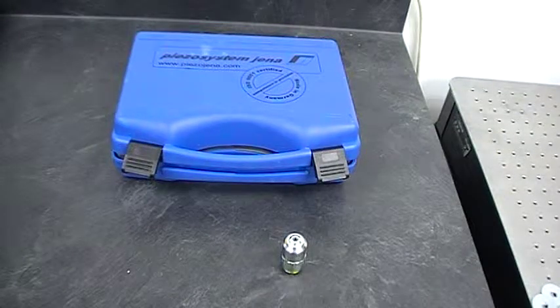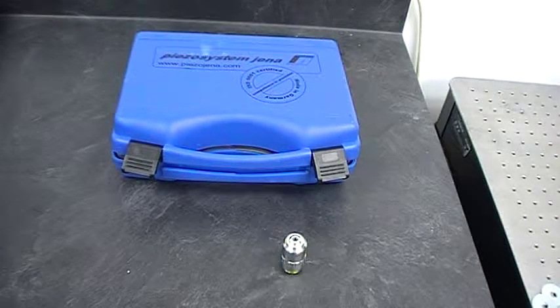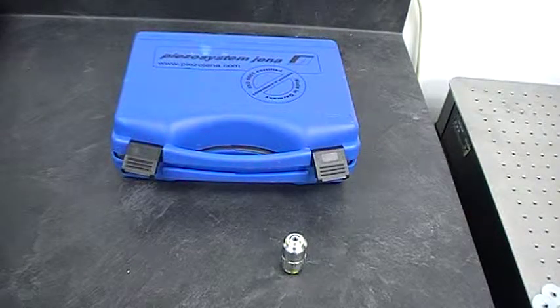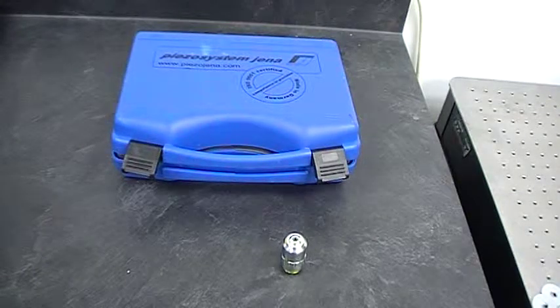This is a demonstration for the MIPOS Objective Lens Positioner — how to put lenses into it and take them out, and how to mount it into your microscope.